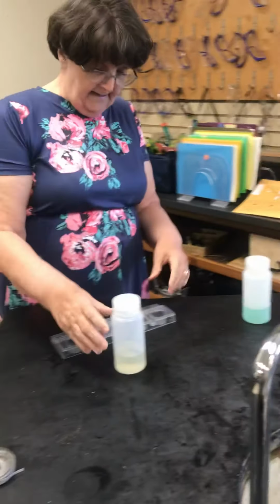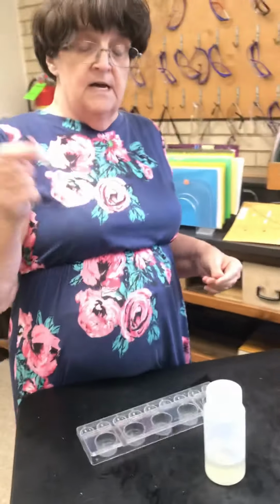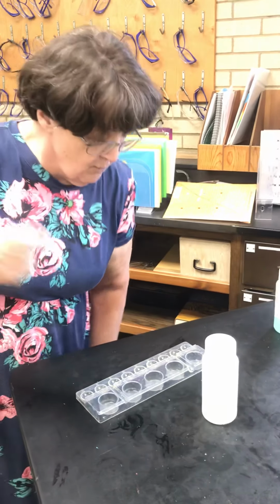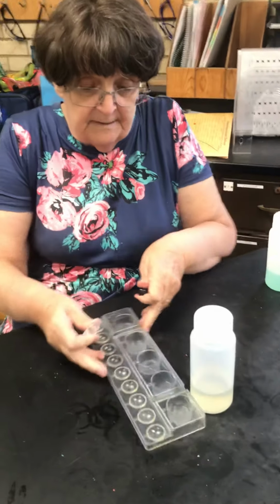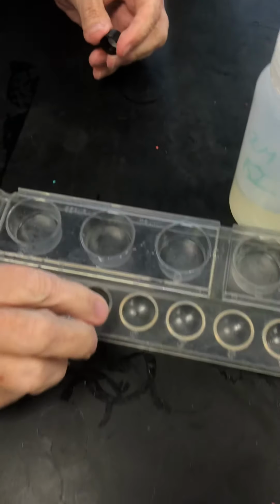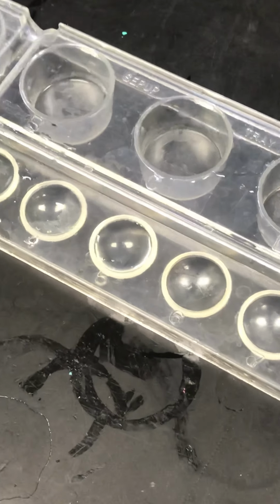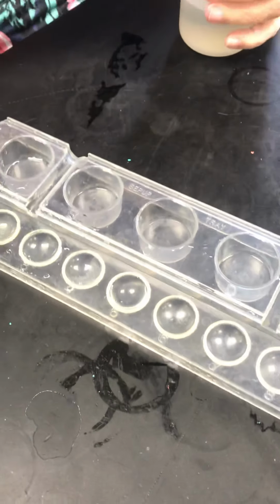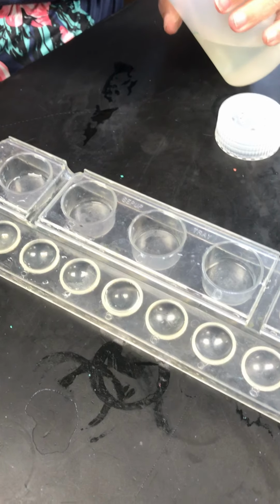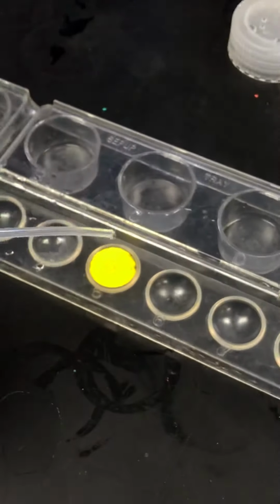So here goes anything. A little bit of lead nitrate. Lead nitrate, being ionic, dissolves in water. So I'm going to pour some in one of these little cups. Little lead nitrate. And I'll grab one of the little squeeze-its and take some KI. And we'll put a few drops of this in there. 1, 2, 3, 4, 5.